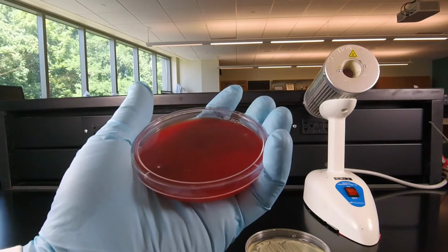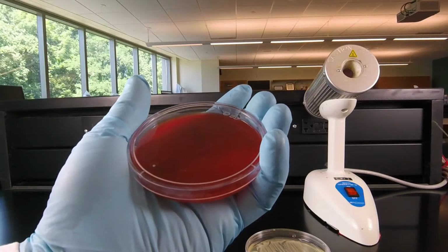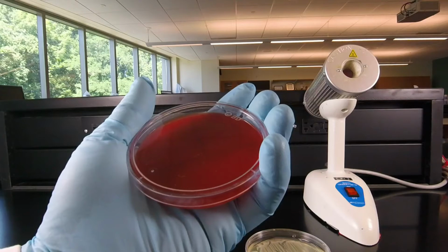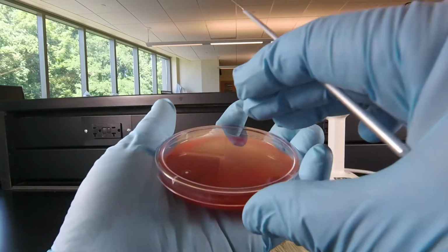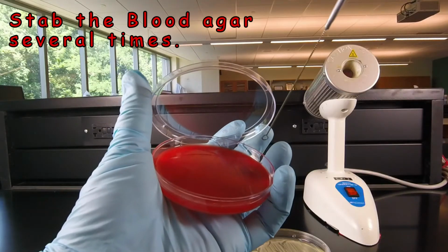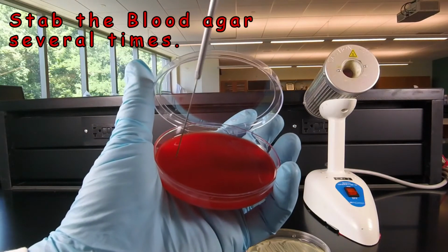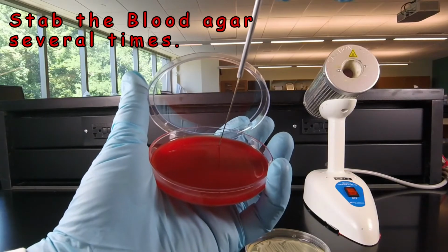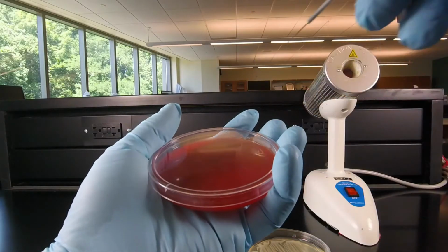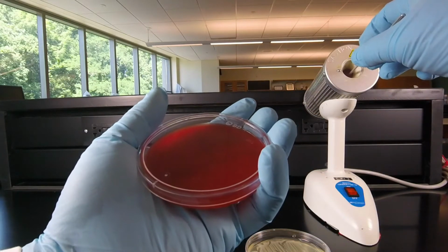However, with blood agar, we always stab the agar. Some of the hemolysins are inactivated by oxygen, so by stabbing the agar, we can get more hemolysis more rapidly. So once you've streaked the plate, you don't have to re-sterilize the loop when you're done with sector 3. Just take your loop and make a couple of stabs in each of the 3 growth areas. And then we're done with the inoculating loop so we can sterilize that.